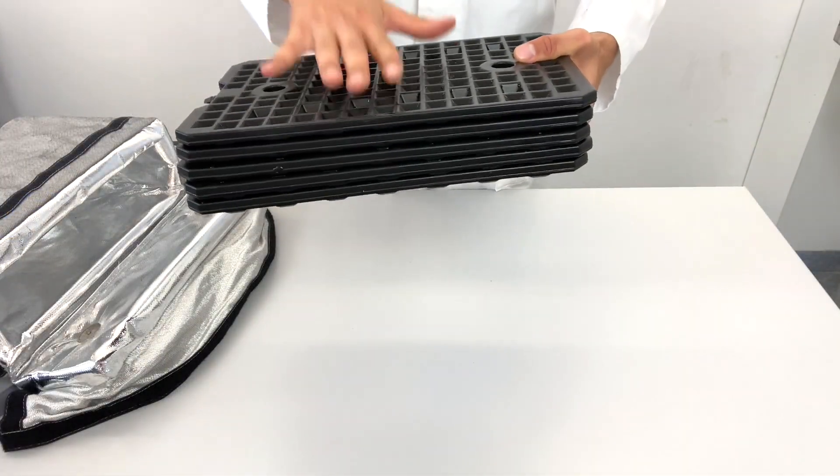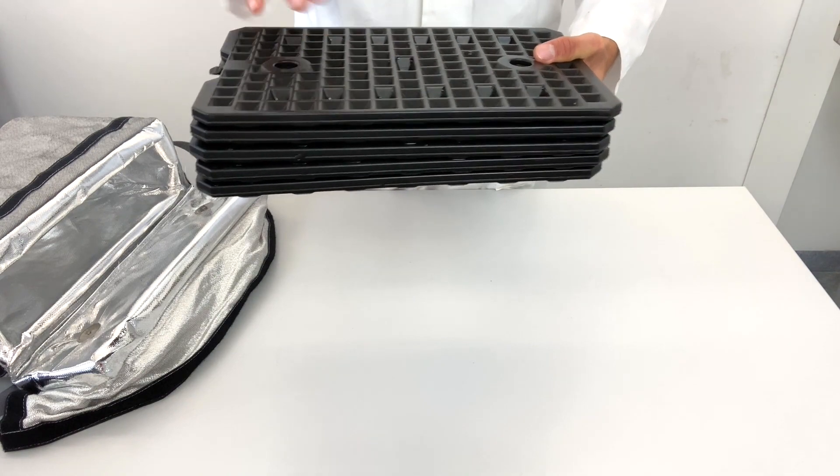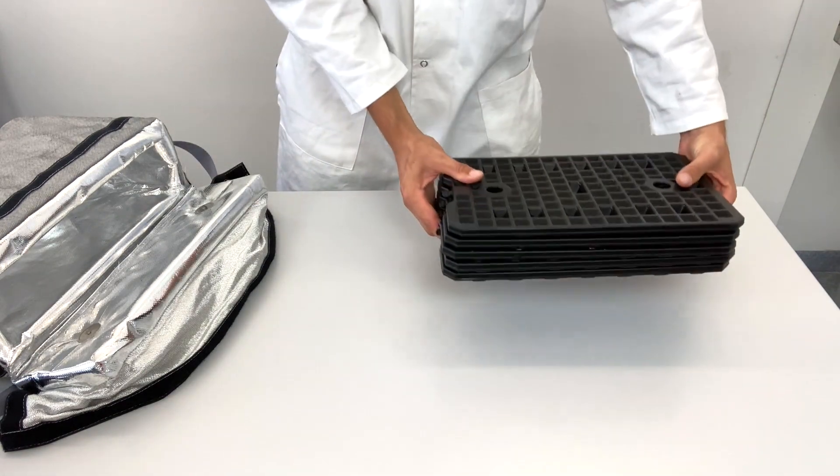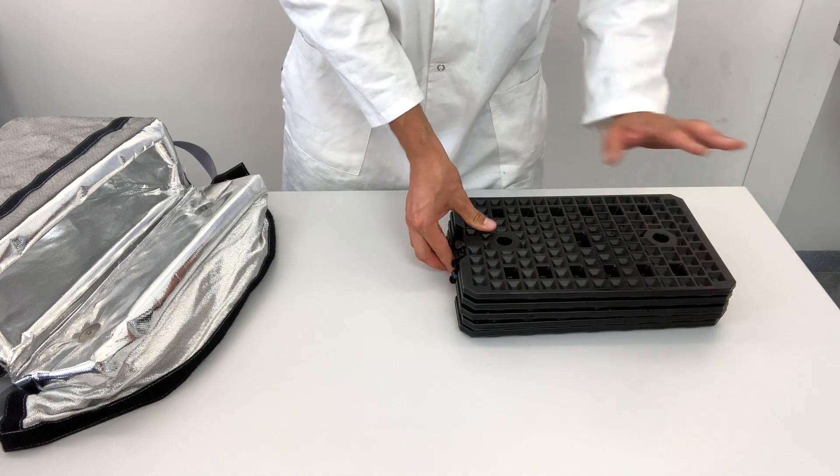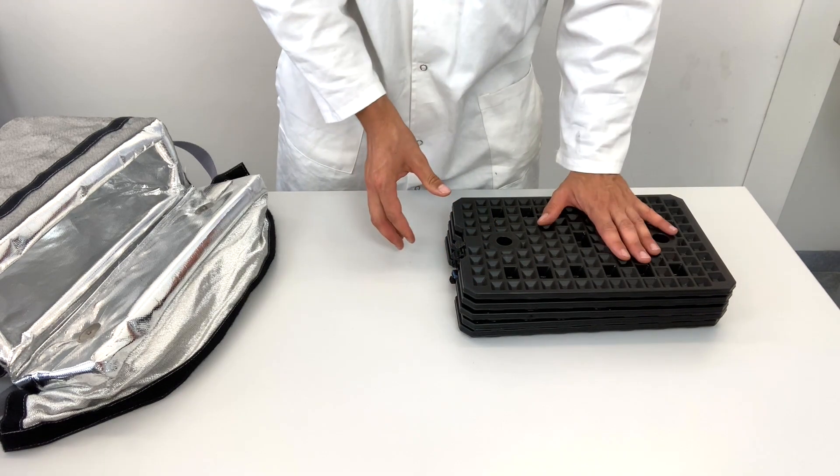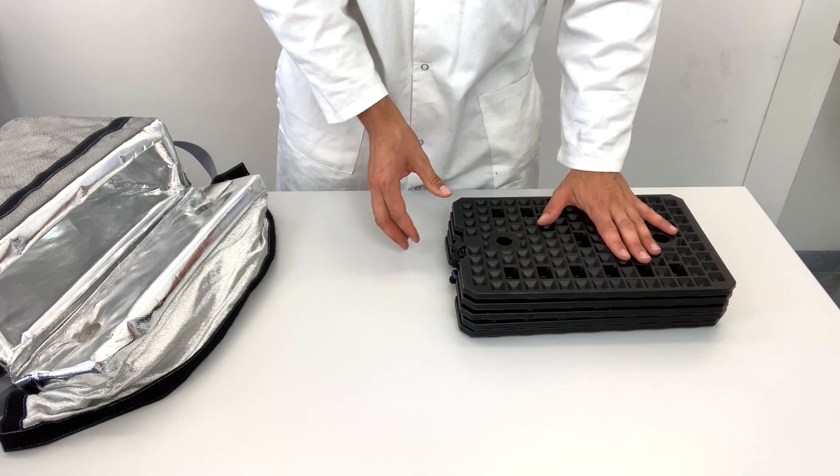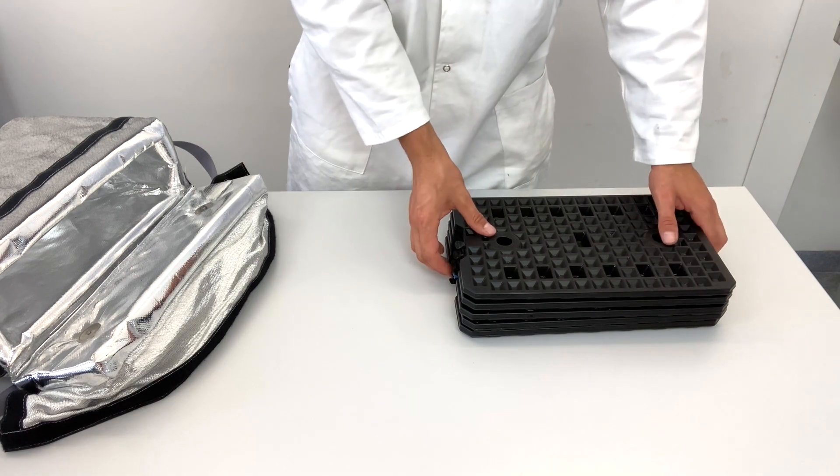Note that if the plates have a felt temperature of more than 40 degrees after activation, for example because you have left them in the sun for too long, cool them down again to a temperature of 38 to 40 degrees before continuing.